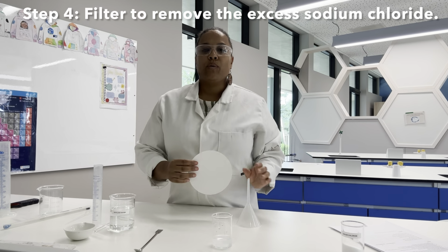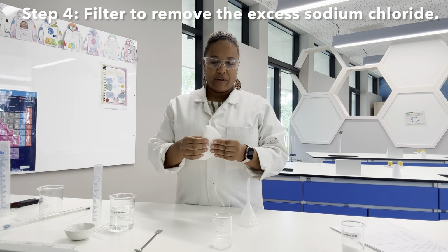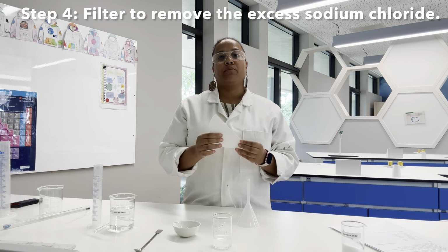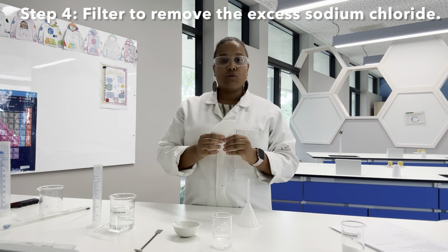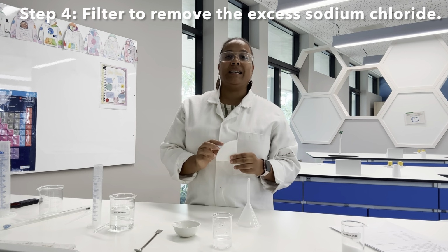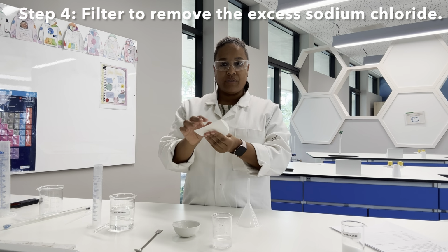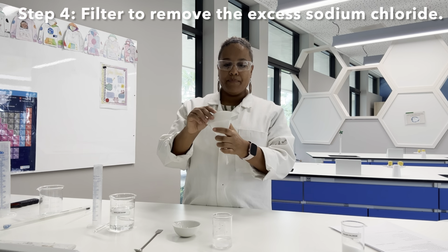Now usually we filter into a conical flask, but today we're just going to filter straight into our evaporating basin. So what we want to be able to do is evaporate off all of the water to work out how much sodium chloride dissolved in that solution. Before we do that, we are fluting our filter paper. So I folded it in half again, and I've got my filter funnel here.